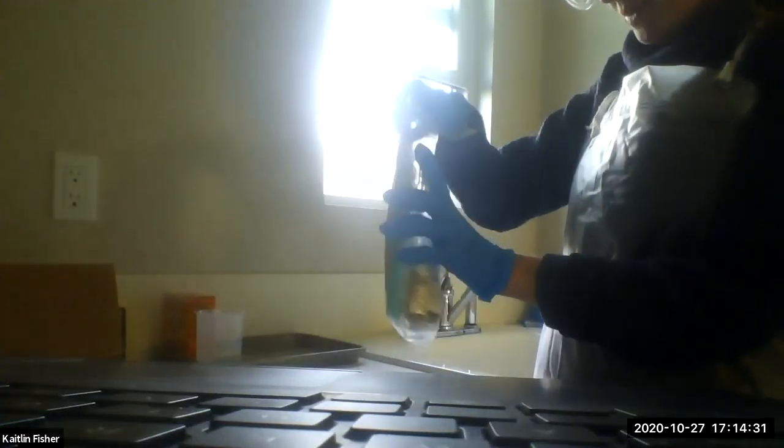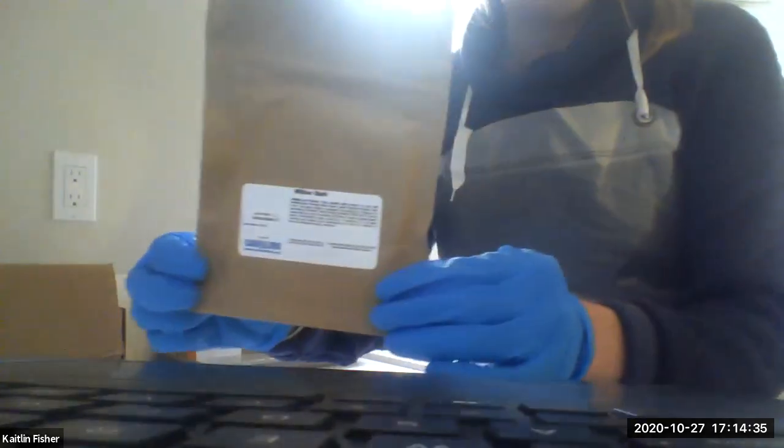Now let's talk about what actually comes inside of this kit chemically that you'll need. In your brown paper bag, this is going to be your willow bark. This is the bark from the willow tree, which was used by indigenous populations for centuries in Egypt, South America, and China. They would chew it, or make a tea out of it, to extract salicylic acid. You'll be doing the same thing. Don't chew it, all right?